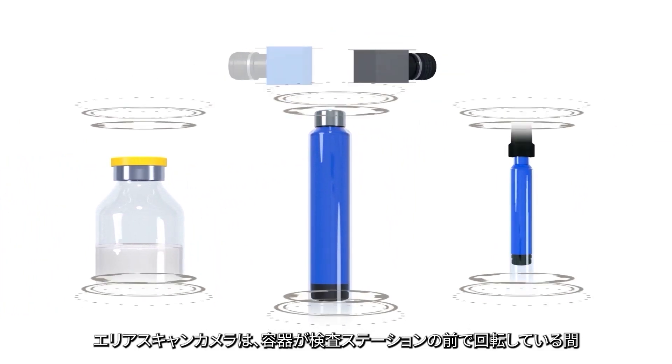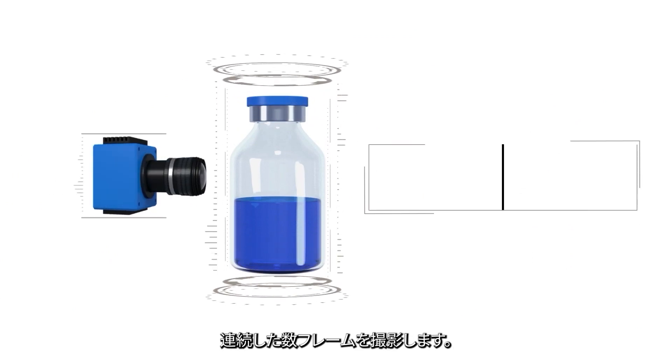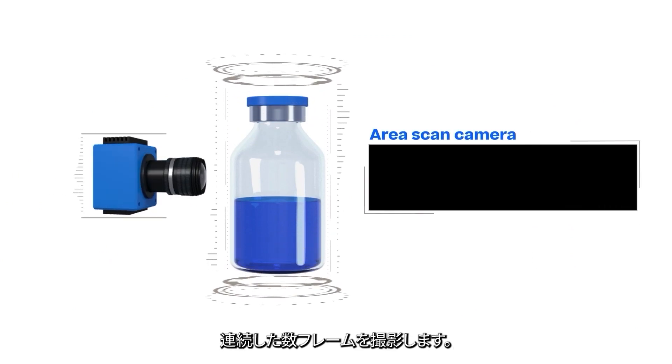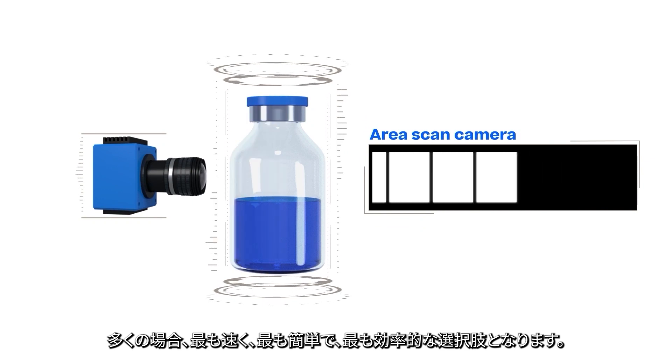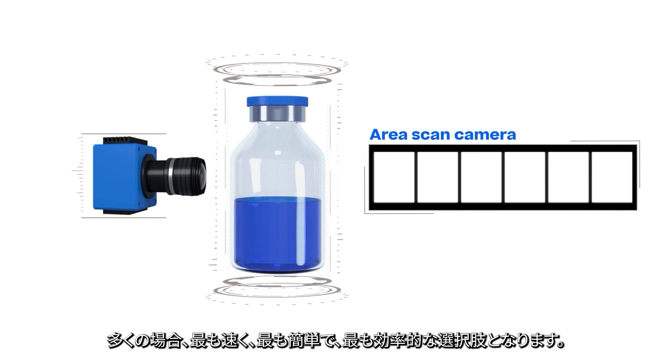The area scan camera takes several consecutive frames while the container is rotating in front of the inspection station. This is often the fastest, easiest or most efficient option.